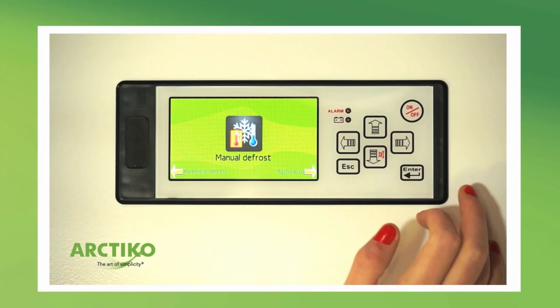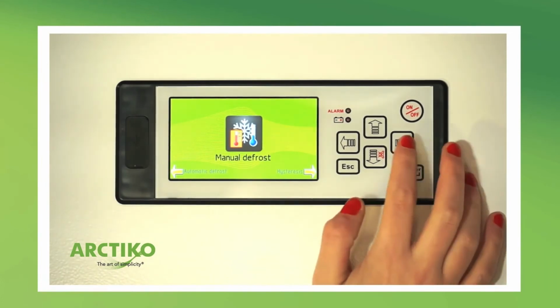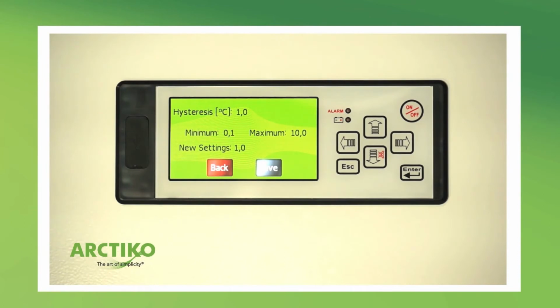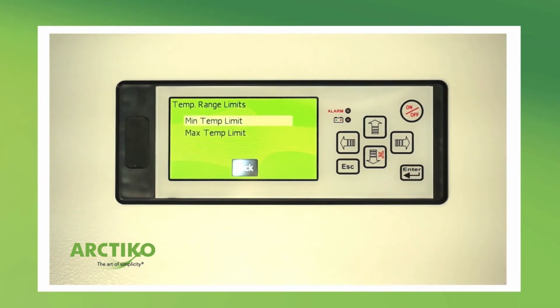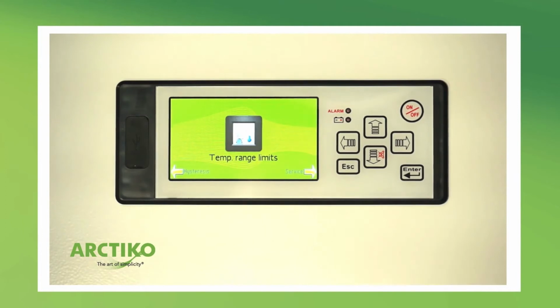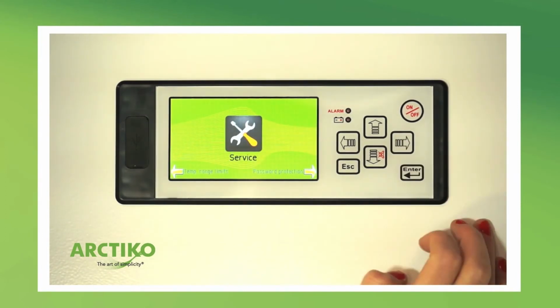In manual defrost, you can start the defrost immediately. In hysteresis, set the difference of the set point when the compressor starts and stops. Temperature range limits is the maximum and minimum temperature the unit can operate in. Service menu shows important information about the service of the unit.